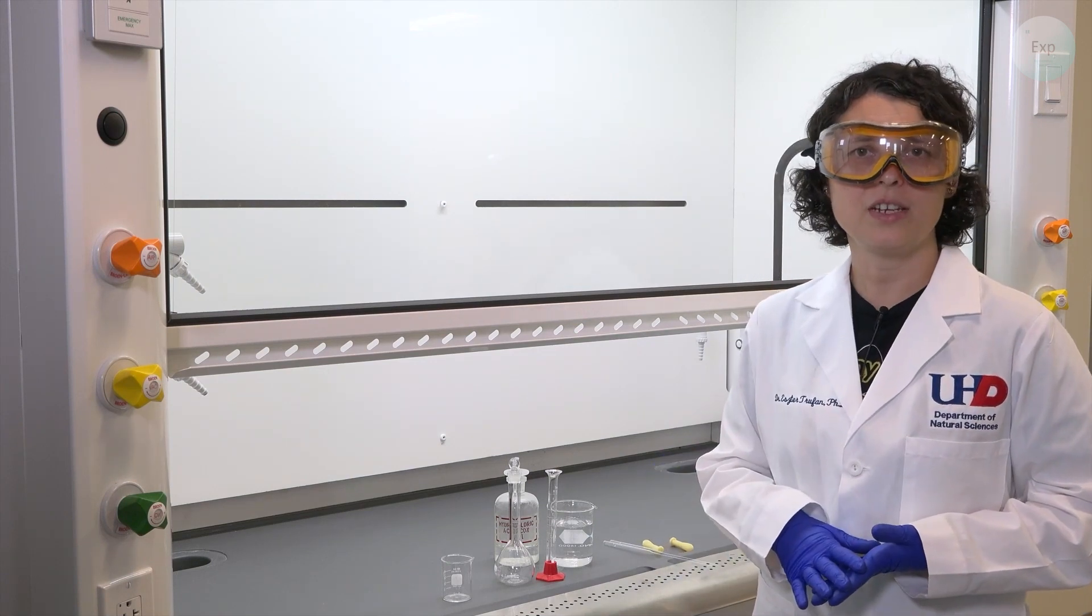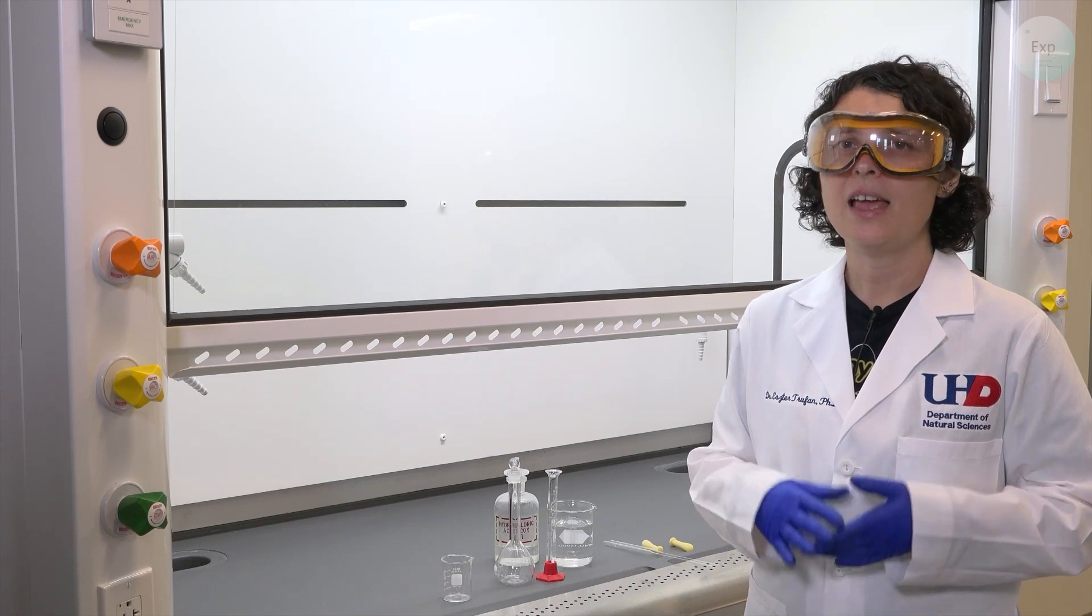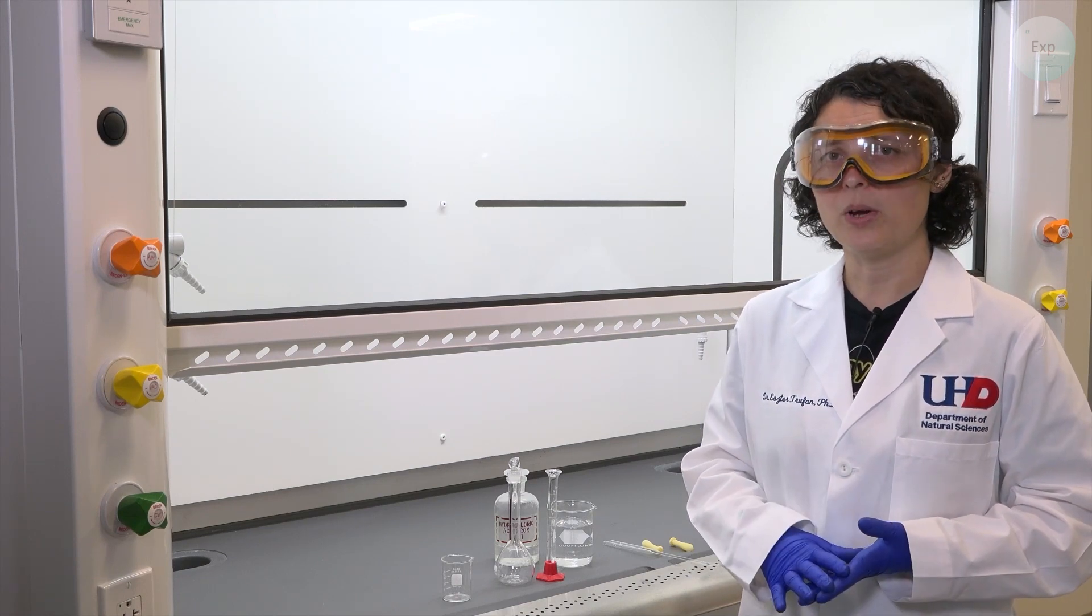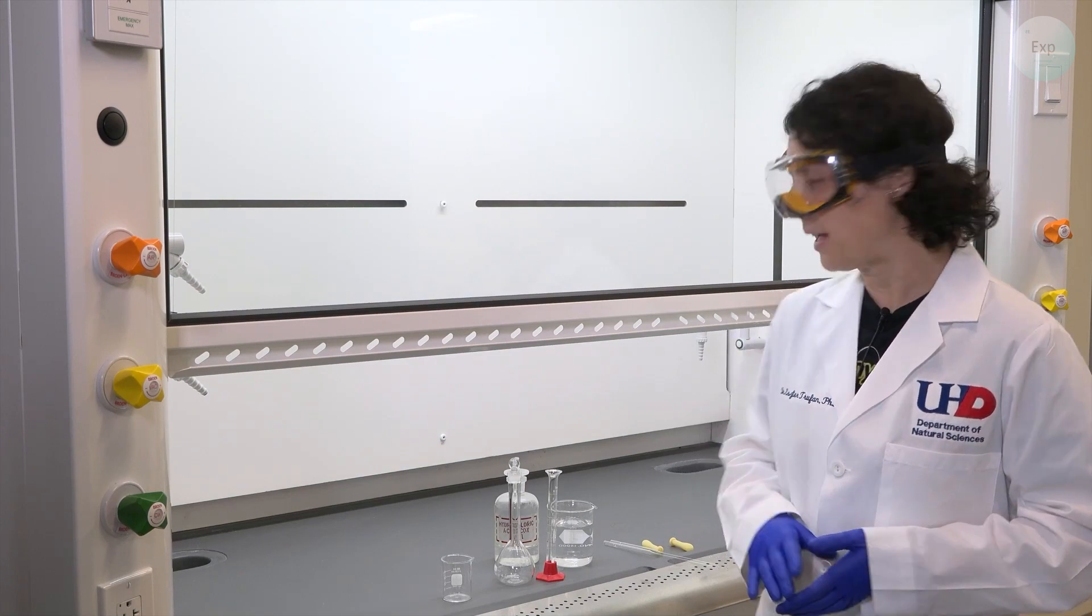The dilution of concentrated acid usually produces a substantial amount of heat and to contain that heat and not allow our solution to overheat, we want to perform this dilution in an ice water bath.